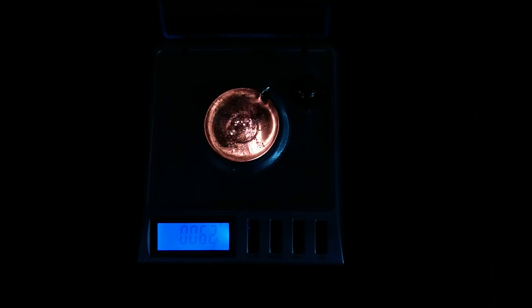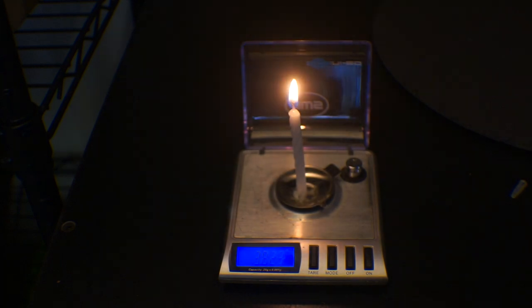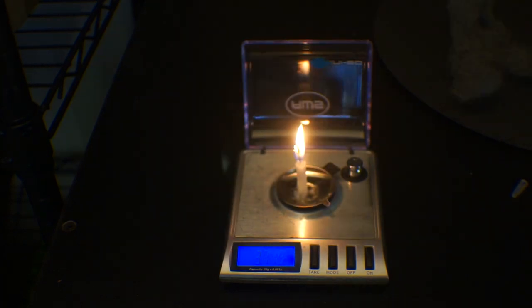In this case, we started with 59 milligrams of iron and ended up with 63 milligrams of product. That's very different from what we see with like a birthday candle, which mostly burns away. I want to make a 2D propagating reaction where iron is restricted to a thin plane and the reaction spreads out across it.